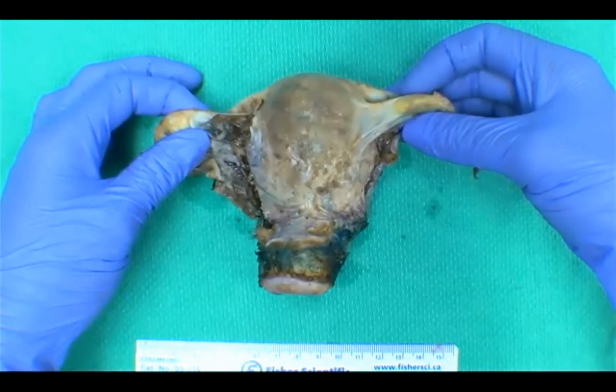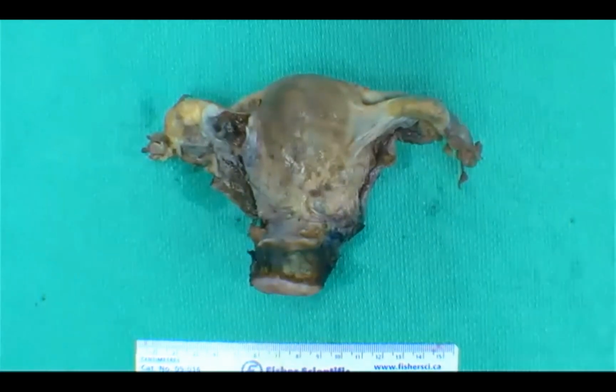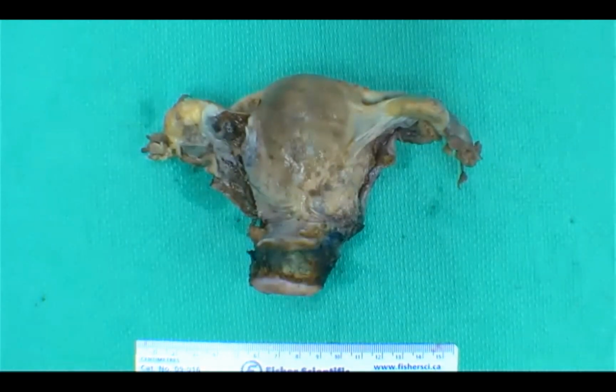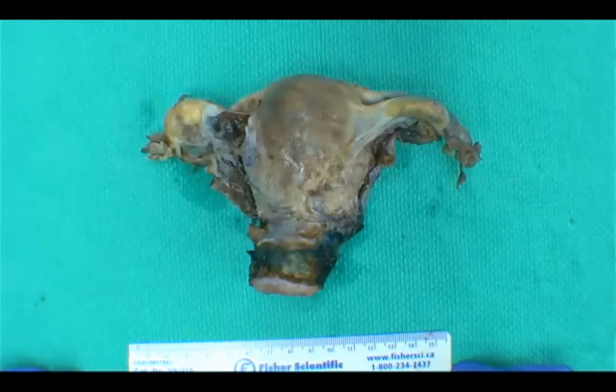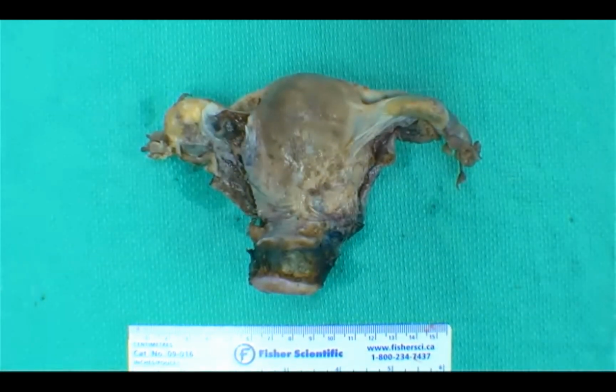What do we call the precursor lesions to cervical cancer, right? LSIL, HSIL. For people that don't know, it's low-grade squamous intraepithelial lesion and high-grade squamous intraepithelial lesion, AIS, great. Basically, any of the precursor lesions. You can also have glandular lesions that are pre-malignant in the cervix. And again, we're just trying to zero in on that because I think from what you saw, the cervix does not look normal.